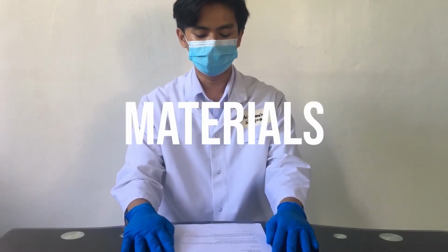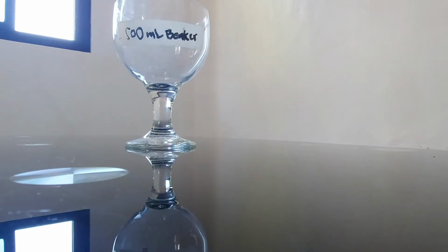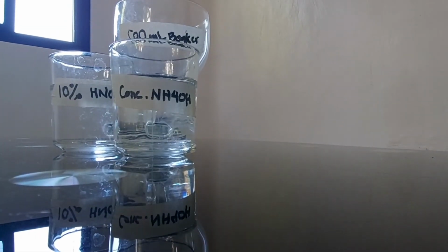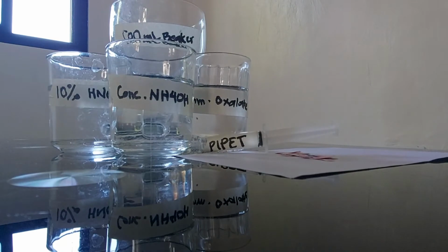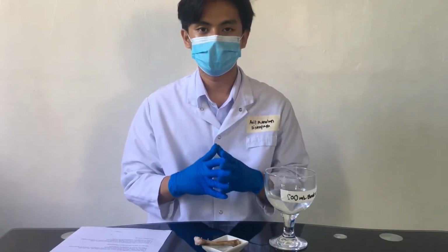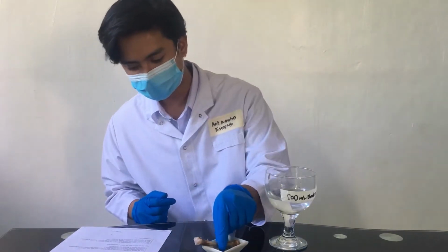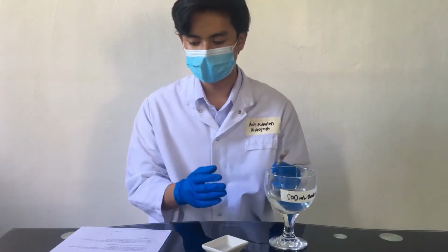So let's start first with the materials. First, we're going to be needing a 500 ml beaker, 10% nitric acid, concentrated ammonium hydroxide, saturated ammonium oxalate, foil, litmus pH paper, pipette, and lastly, our tissue specimen. So for the procedure, first, we have to place the pieces of calcified tissue into the 500 ml beaker filled with 10% nitric acid.